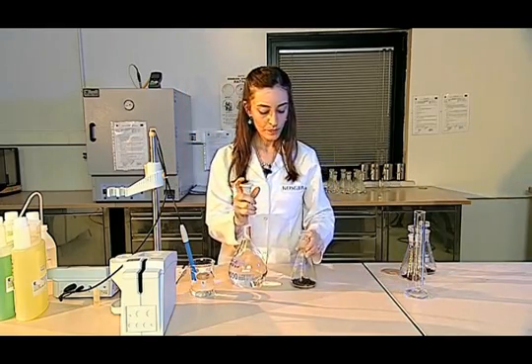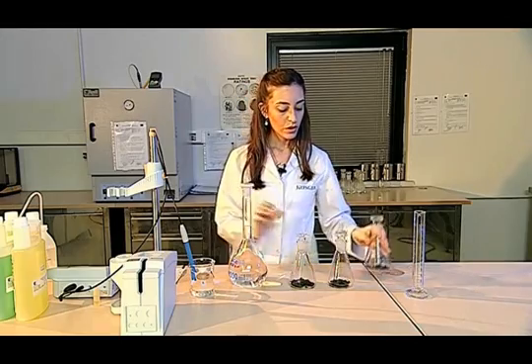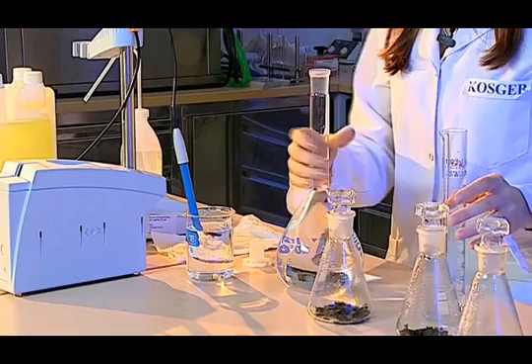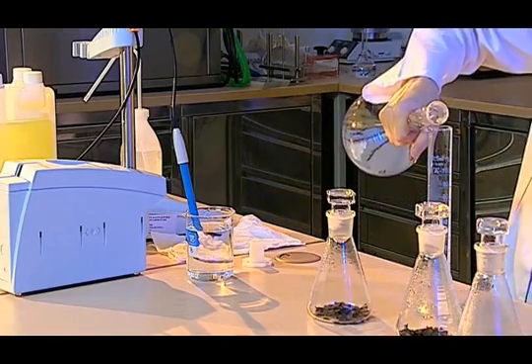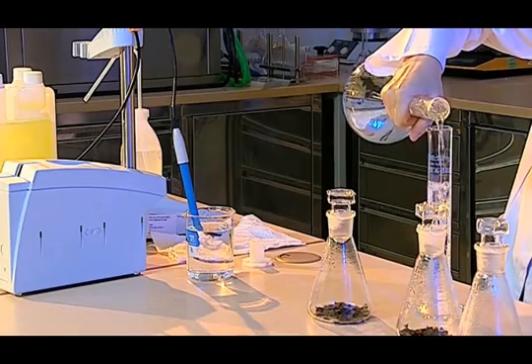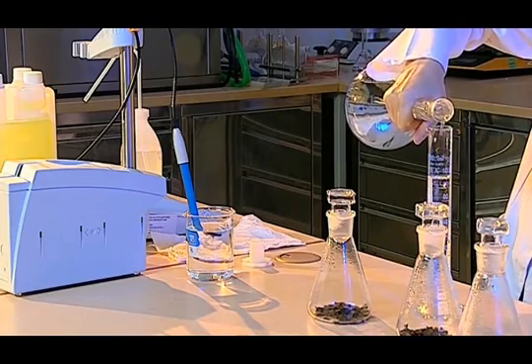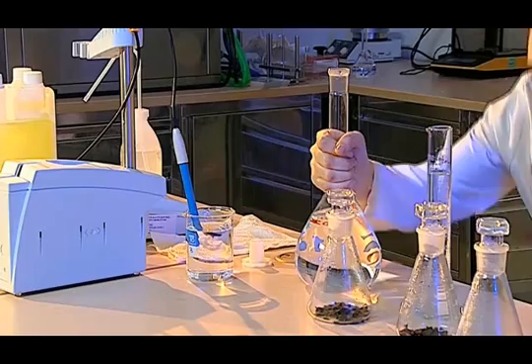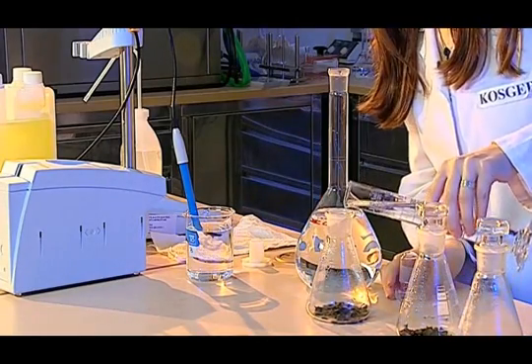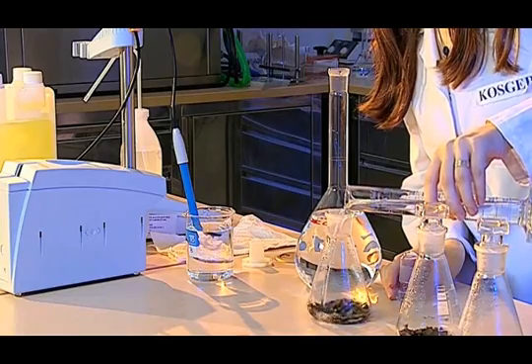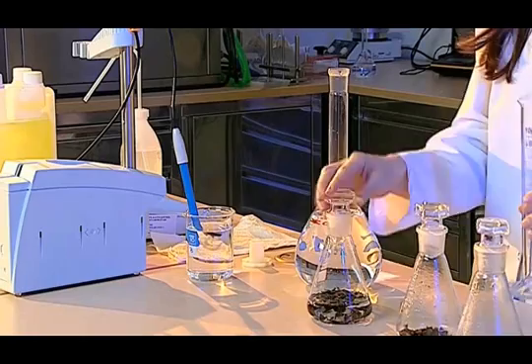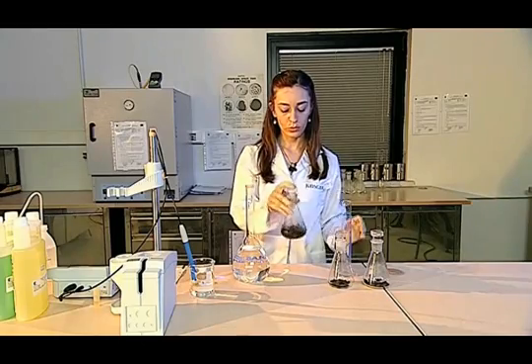In the next step, I apply the solution that I have prepared to the samples. For this, I apply 100 ml to each sample. I make sure that in colorless liquids, the lower surface of the liquid is in the line. In this way, I apply the solution.